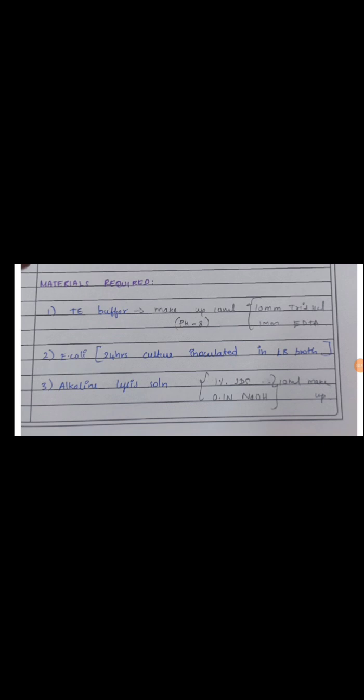Here the materials required: TE buffer, we have to make up to 10 ml. The pH should be maintained at 8, and the components of the TE buffer are 10 millimolar Tris-HCl and 1 millimolar EDTA. These concentration calculations I will give at the end. If you want, check it at the end of the video. Then E. coli culture, here we have to inoculate in LB broth. We have a 24 hour culture inoculated in LB broth. E. coli culture we want.